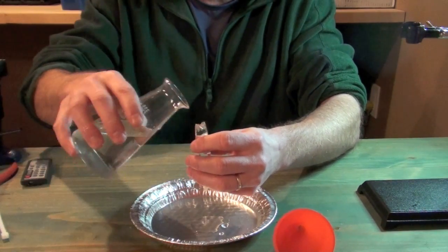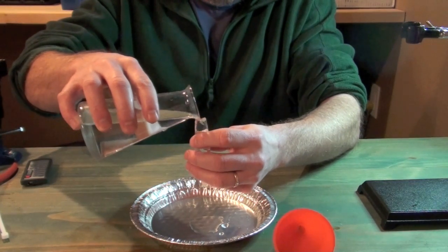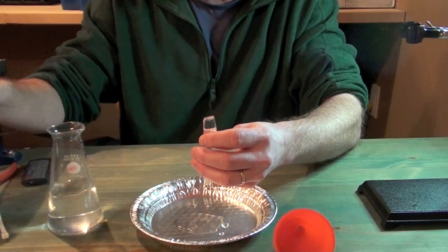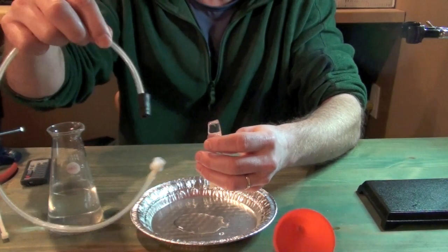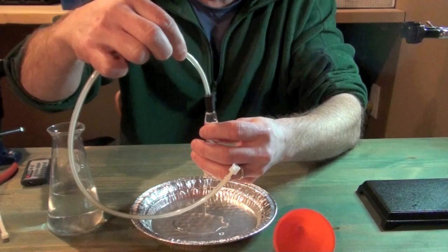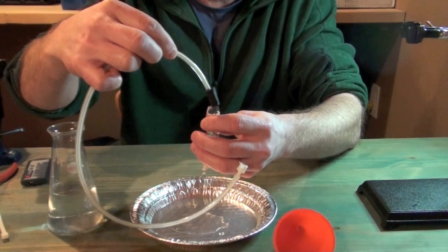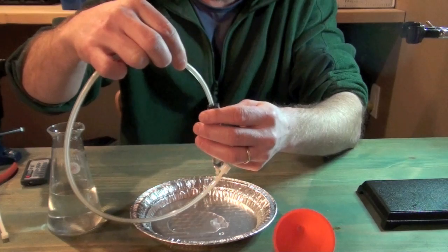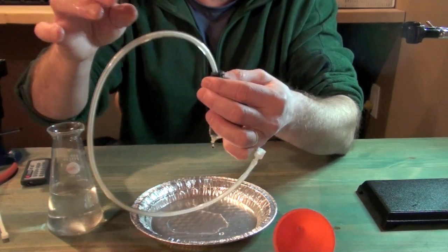If we squeeze it a tiny bit, it'll open up our end. I'm just going to add a bit more to make sure my baggie is completely full. Then I'm going to take my rubber stopper and just insert it right into the end of the dialysis tubing, just like that, and slide that right up to the top.